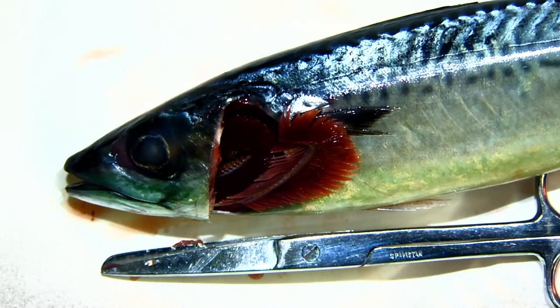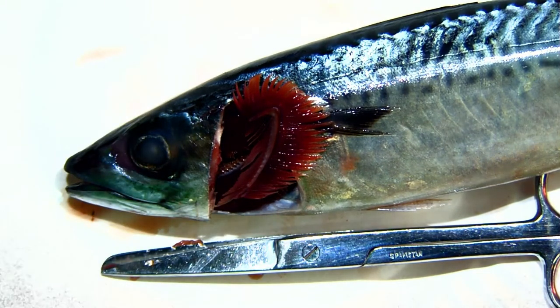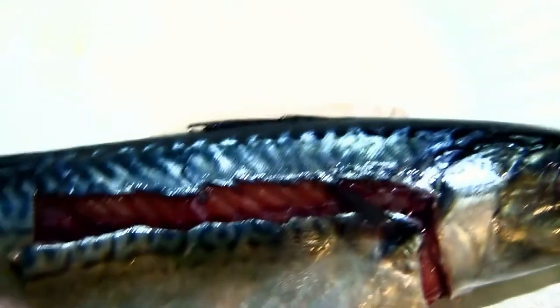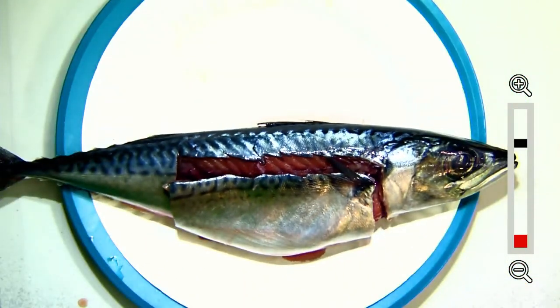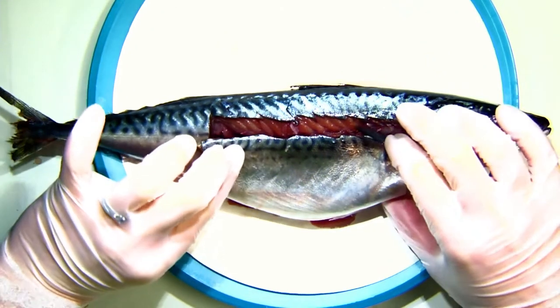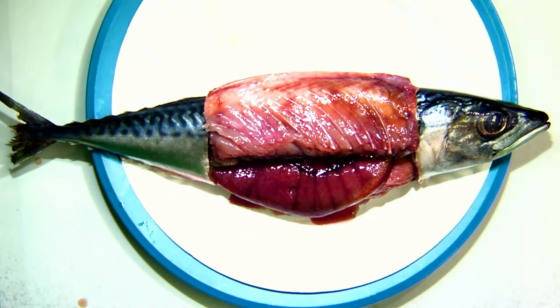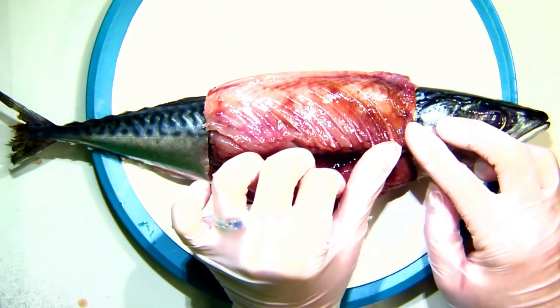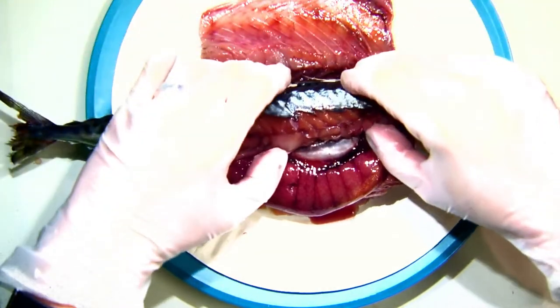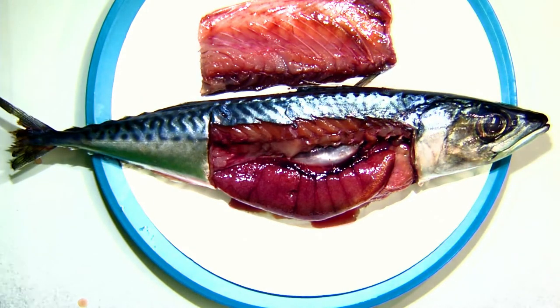We've seen a lot of the outside. Let's move to the inside of the fish. I pre-prepared another mackerel and cut the side off. A fish is a vertebrate, meaning it has bones — you can see the ribs right here. They also have a backbone running along here. This fish is quite big with a lot of muscle, so the bony bits are a little tough to see.